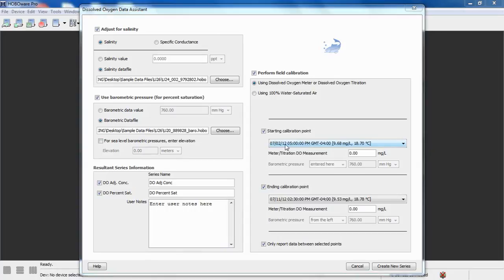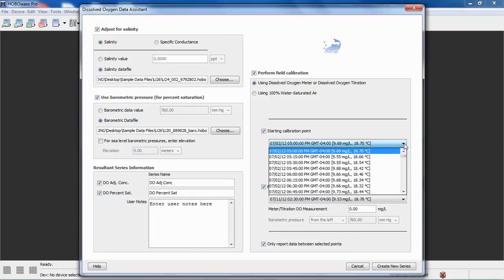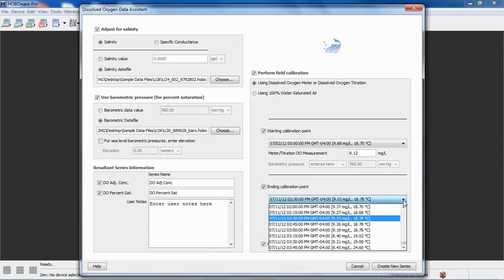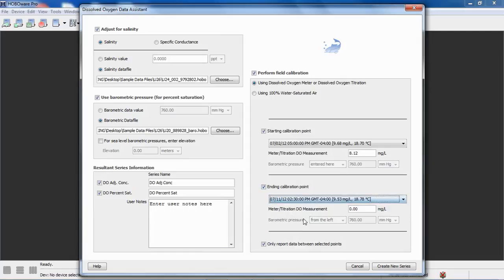For our deployment, we had a calibrated dissolved oxygen meter, so we were able to take measurements and write those down in our logbook. What we're going to do is, these are all our data points in our data file, and we're going to correlate our meter reading to a specific data point during our deployment. So our starting point was at 5 p.m. and it was 8.12. Our ending calibration point was at 2:30 p.m. on the 11th, and it was 7.89.